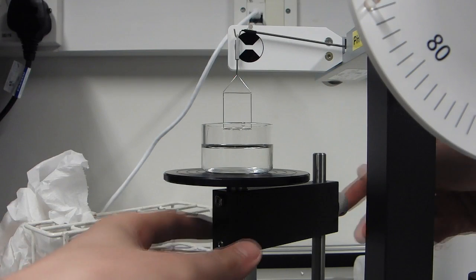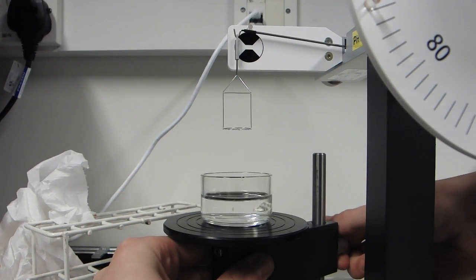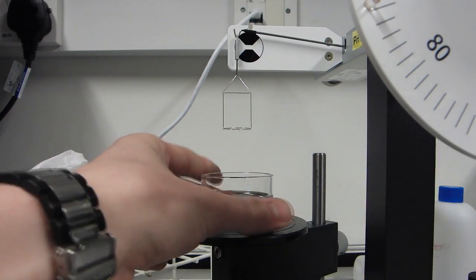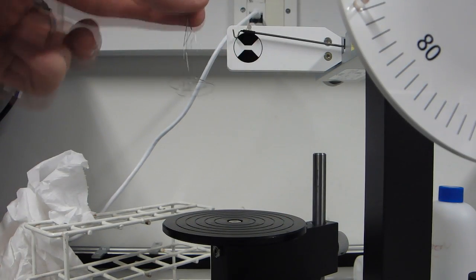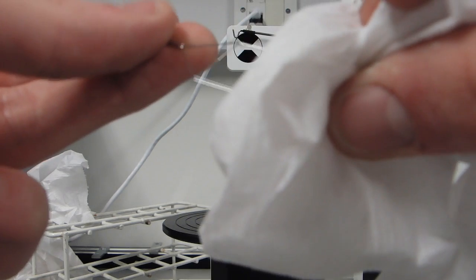With the measurement complete, we lower the stage and remove the sample. The ring can also be removed and cleaned to prevent influencing future measurements.